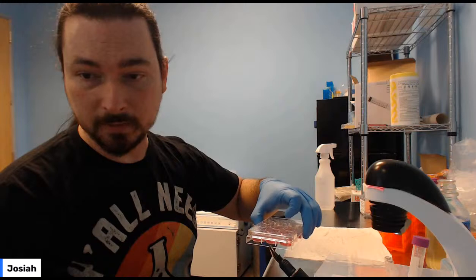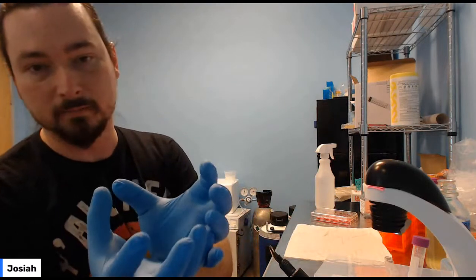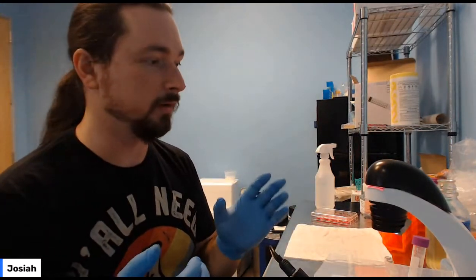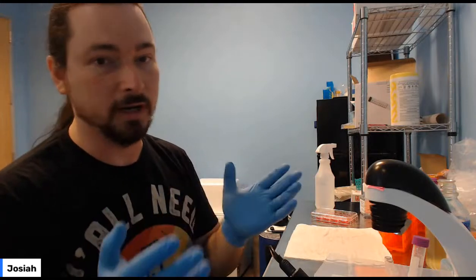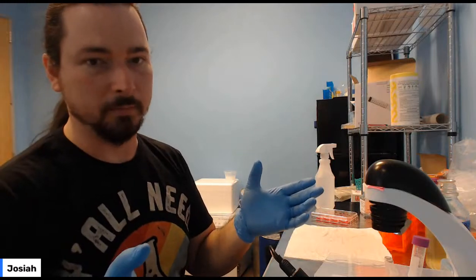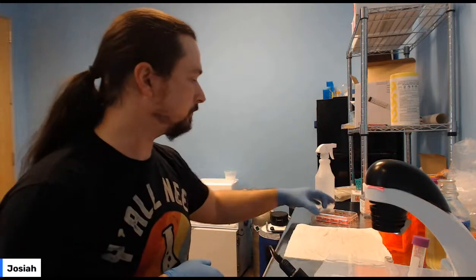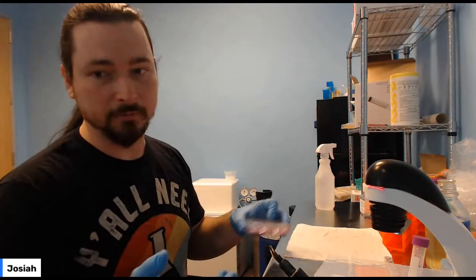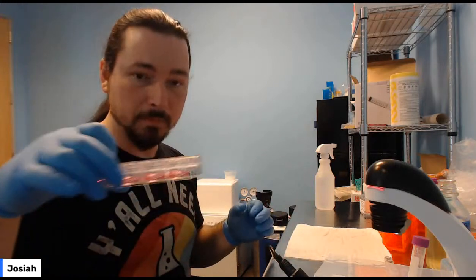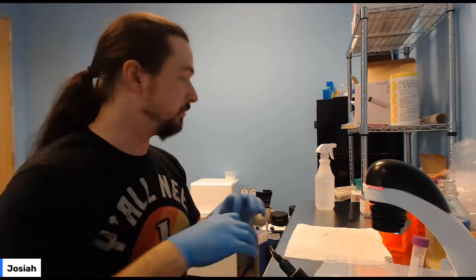What volume of water do you need to keep a plate from drying out in a few days? I usually take a cup like that big, a couple of cups of water, a few hundred mLs or whatever, but it depends on how dry your air is really. So put a cup in there with plenty of water, more than will evaporate in a day or two, and then just check it every day. If it's getting low, put some more water in. And that only works in a closed environment. If you've got it on a heat mat on a countertop, you're not going to moisturize the whole room. But okay, so then pop this in your incubator, label it with the time, stuff like that. And what you're going to do is come back in a few days.